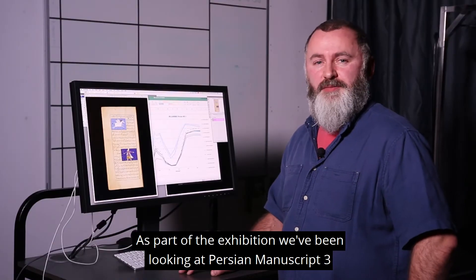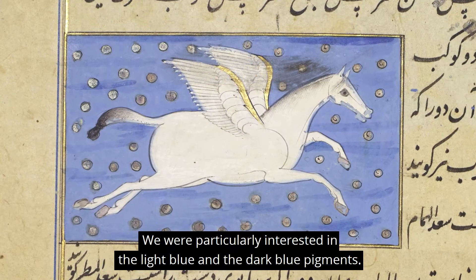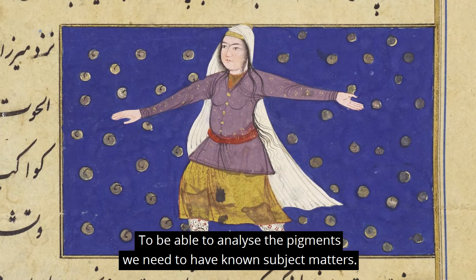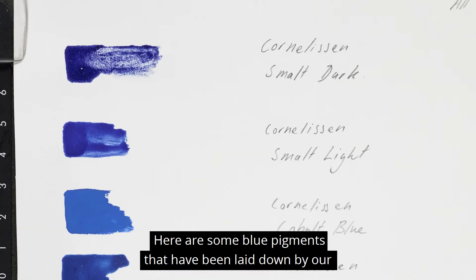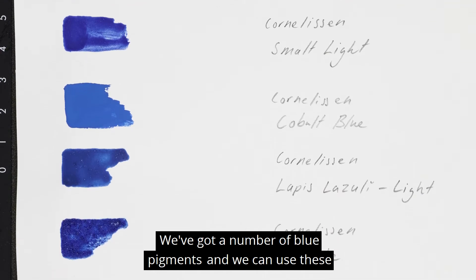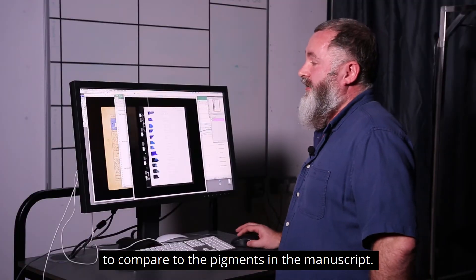As part of the exhibition, we've been looking at Persian Manuscript 3, which is a book on cosmology. We were particularly interested in the light blue and the dark blue pigments. To be able to analyse the pigments, we need to have known subject matters. Here are some blue pigments that have been laid down by our conservator and co-creator of the exhibition, Elaine Sheldon. We've got a number of blue pigments and we can use these to compare to the pigments in the manuscript.